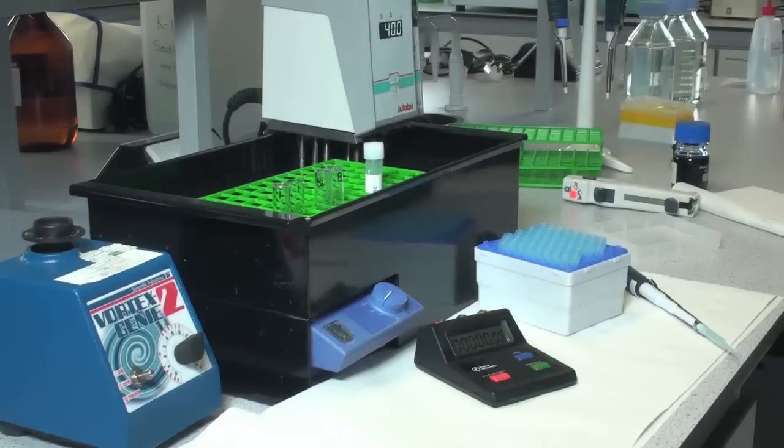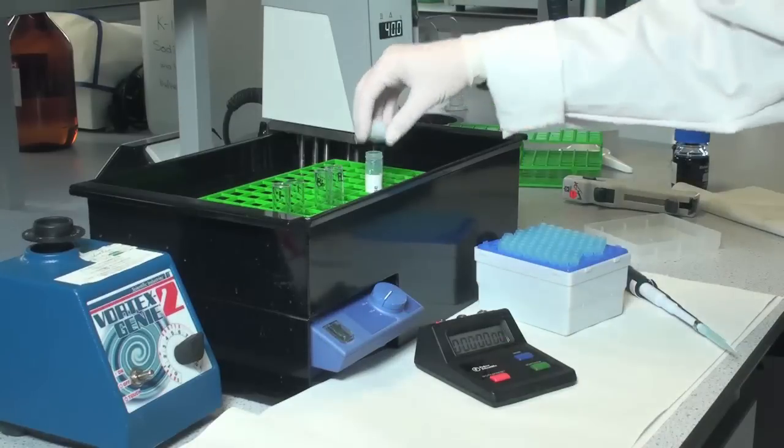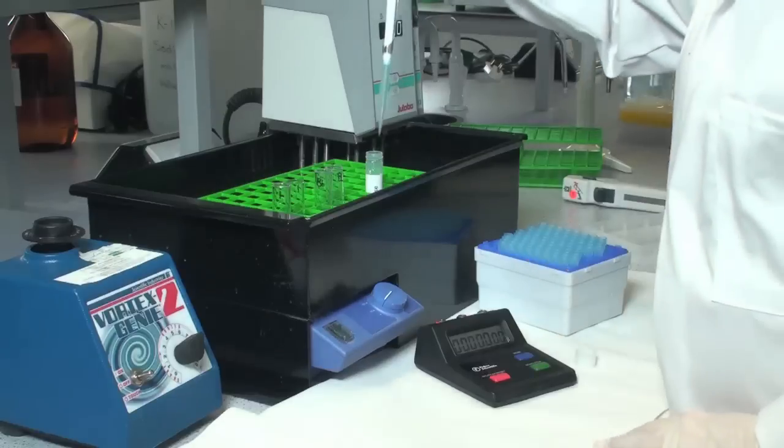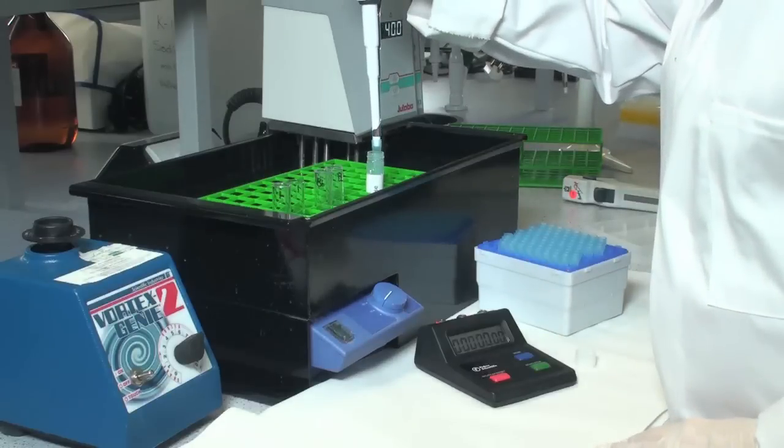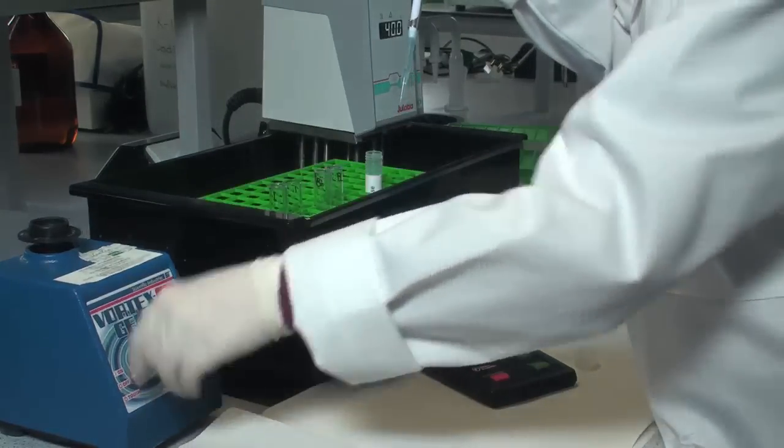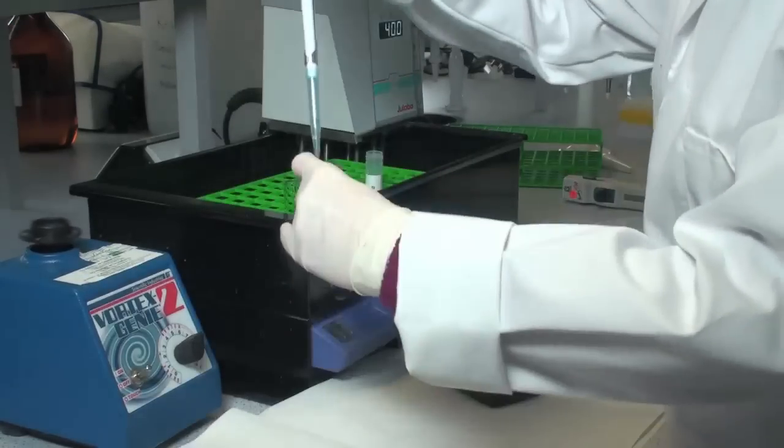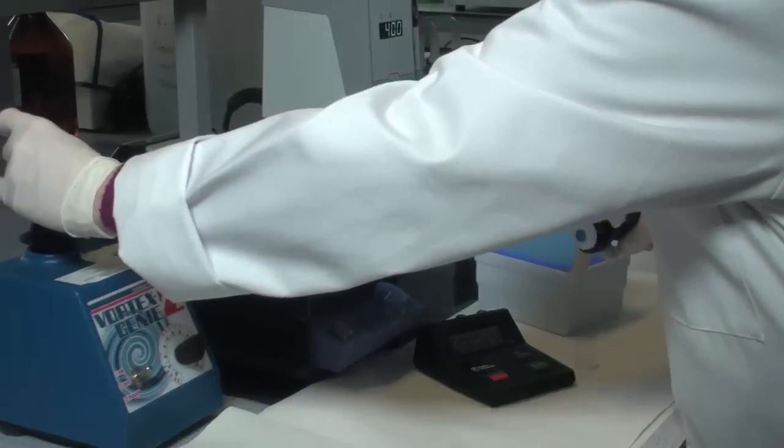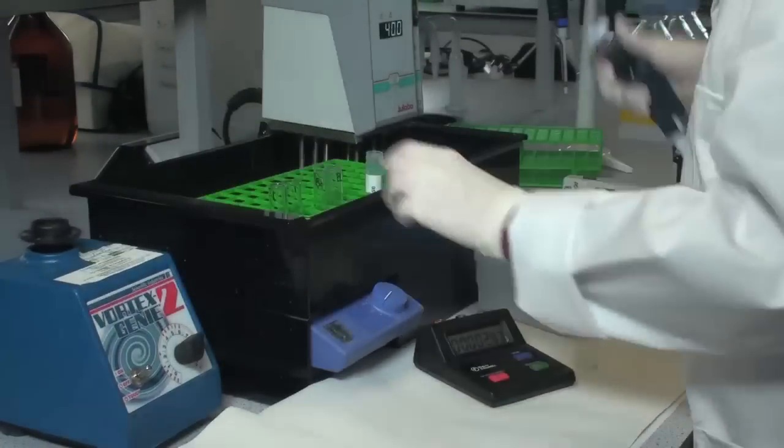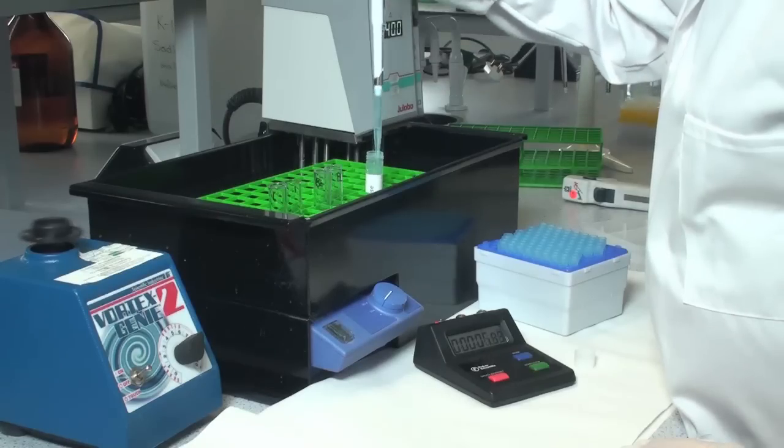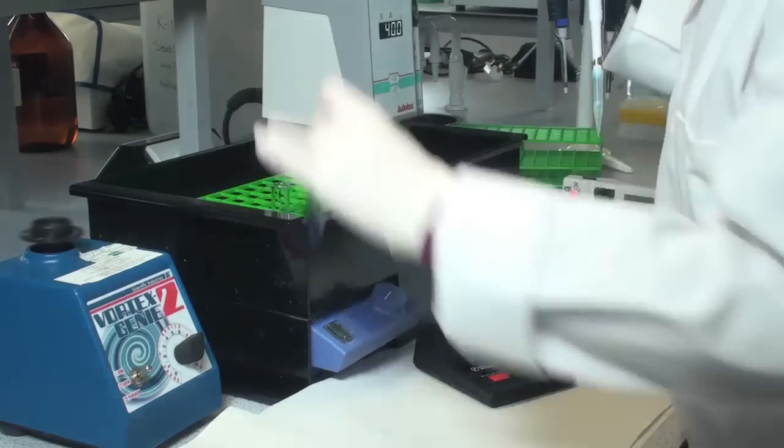Initiate the incubation by adding 0.5 ml of suitably diluted pre-equilibrated enzyme solution to the substrate solution, mixing the contents thoroughly on a vortex mixer and pressing the stopwatch immediately. Do the duplicate incubation after 10 seconds in exactly the same way.